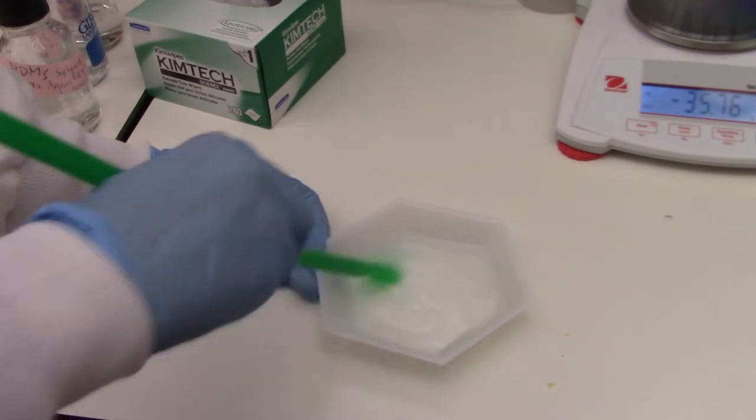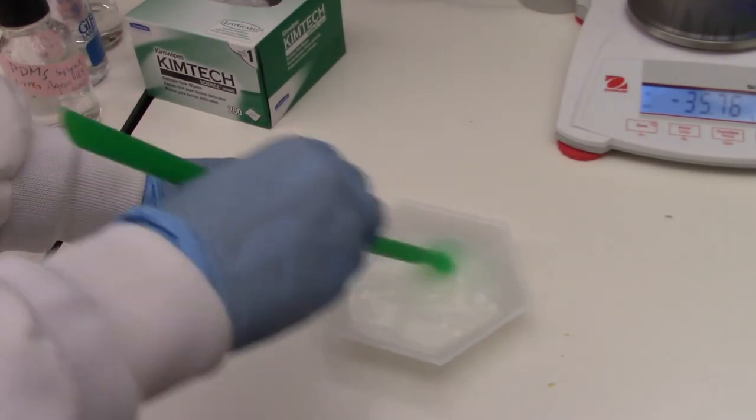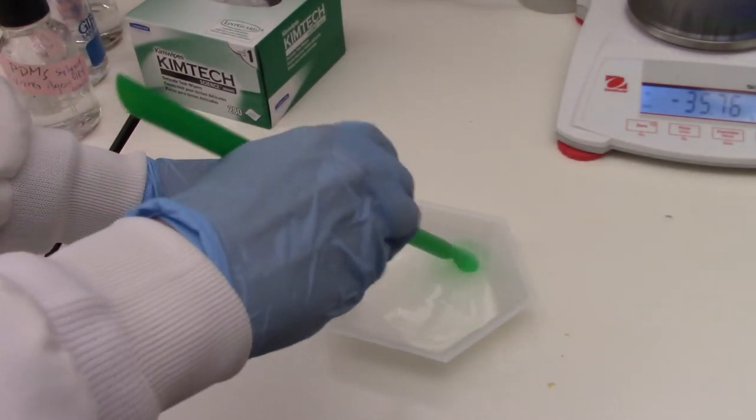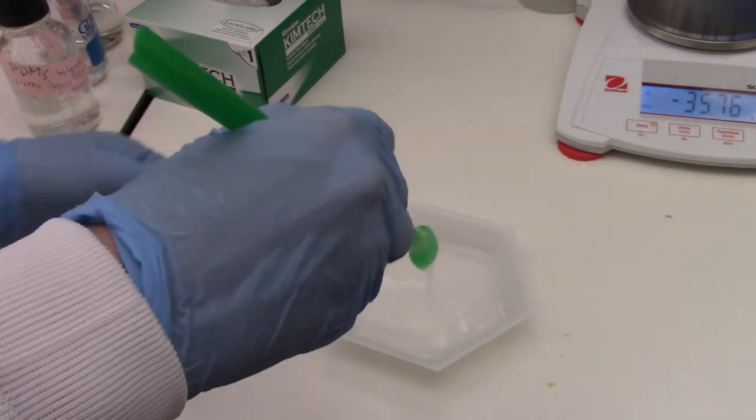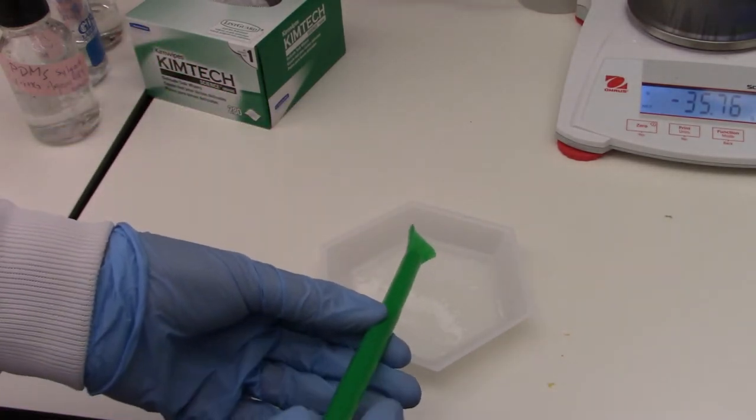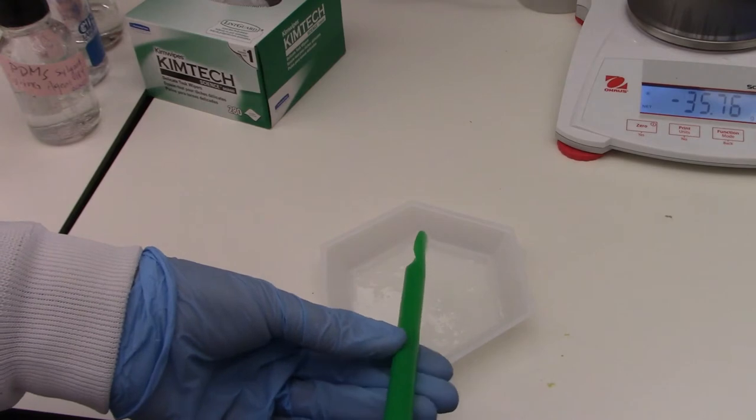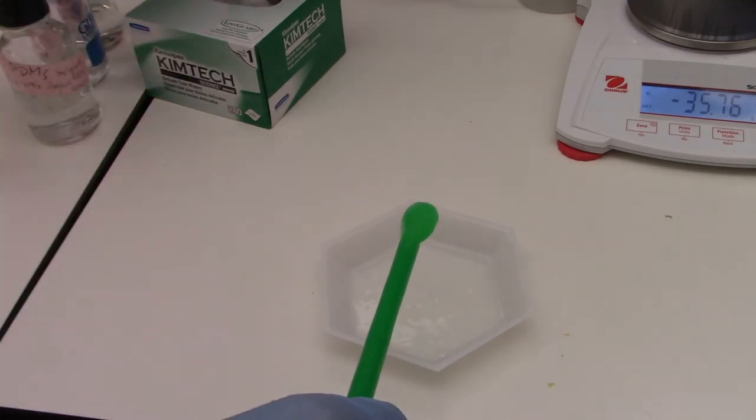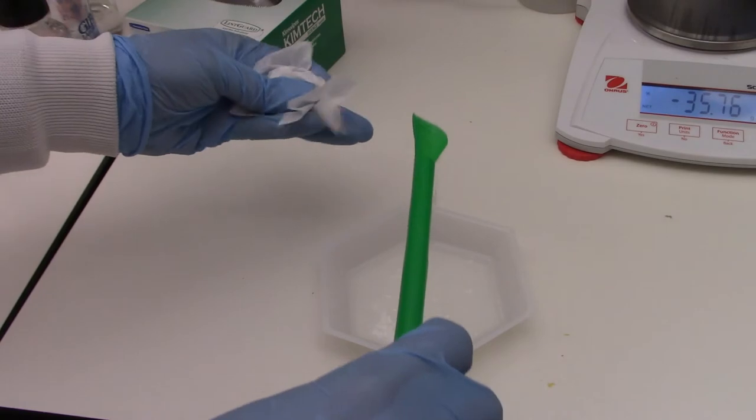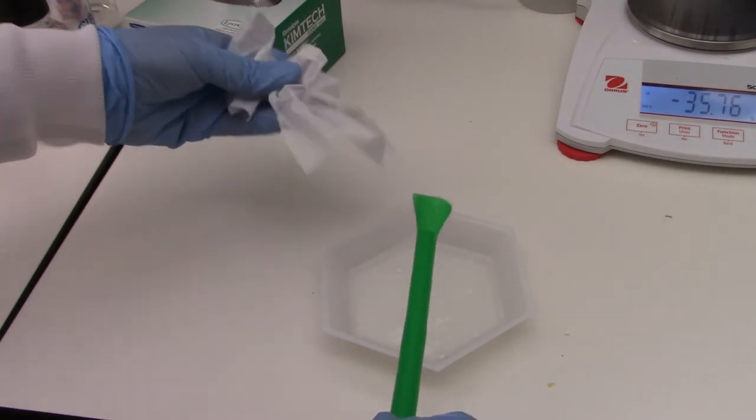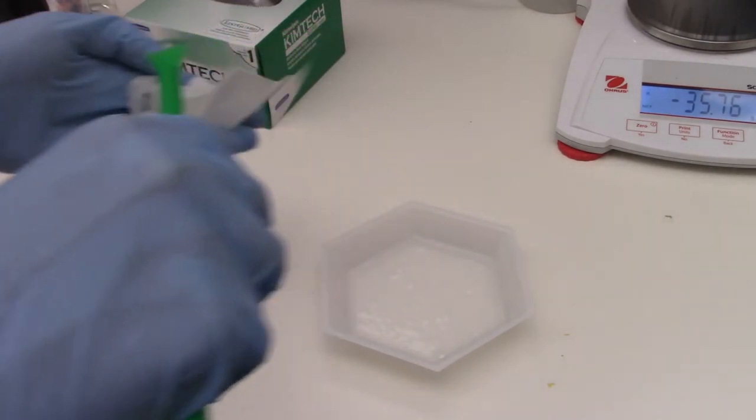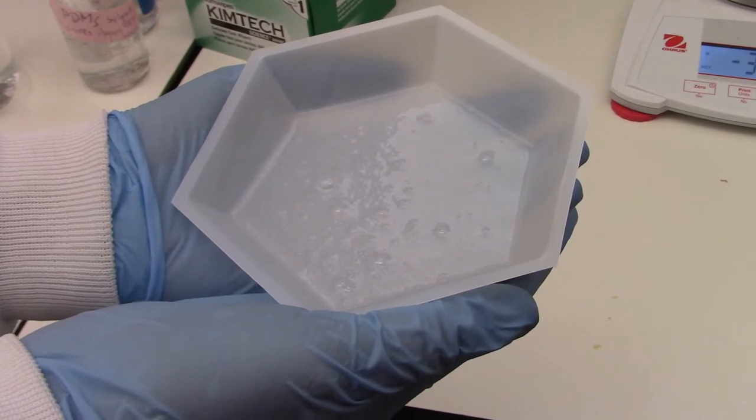All right, that looks pretty well mixed. So again, stop our mixing. When you're picking up your spatula so you don't drip everywhere. I'm kind of spinning it around and holding it over a chem wipe on your way or some kind of disposable items on your way to the trash can.